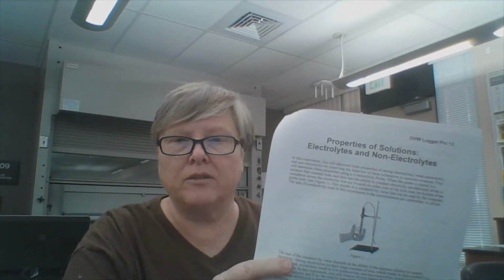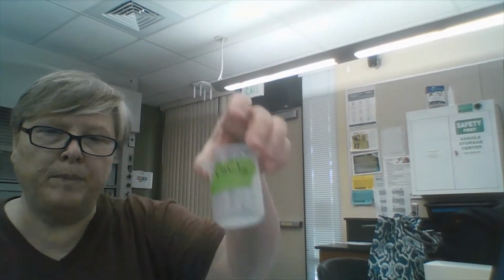Hi, Vicki Williams here. Today I'm going to be doing for you properties of solutions, electrolytes, and non-electrolytes. The way we're going to do this, we've got a whole bunch of little beakers that we're going to put different solutions in.